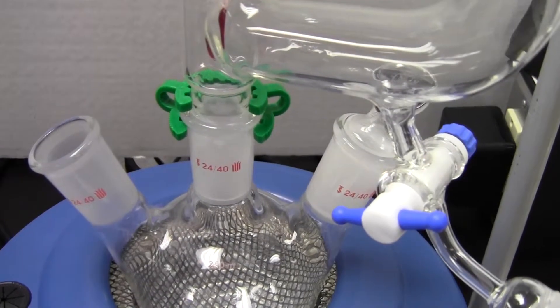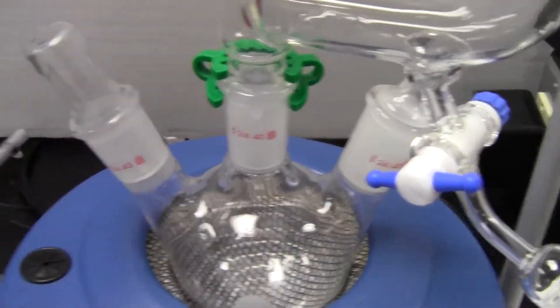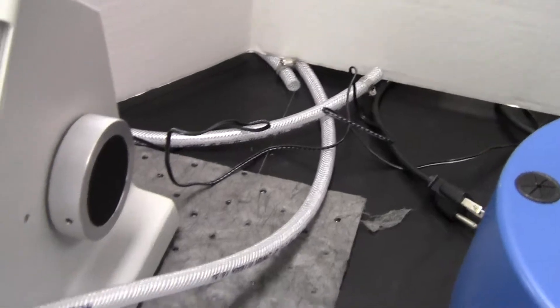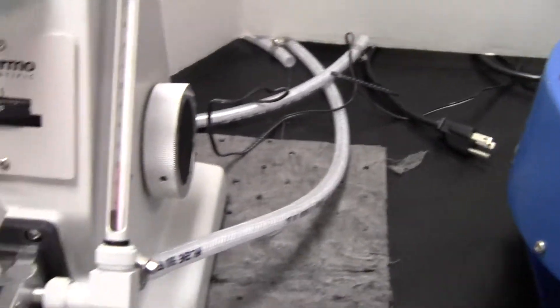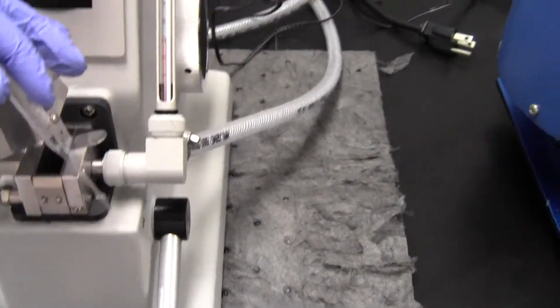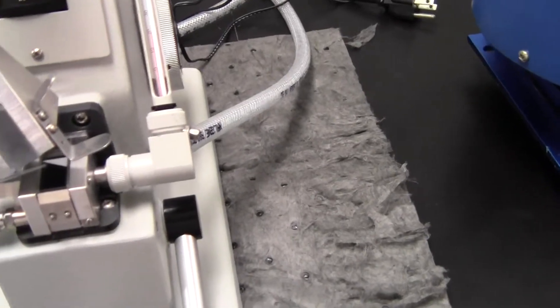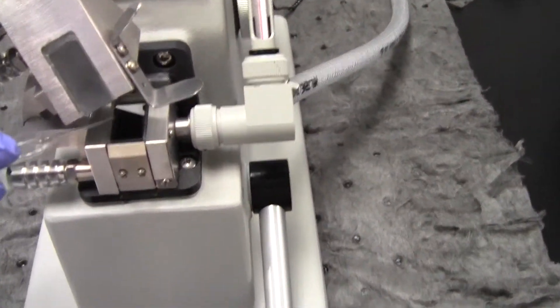Very quickly open that up and take a little bit. You don't need a full pipette full. Remember, it's going to be boiling.